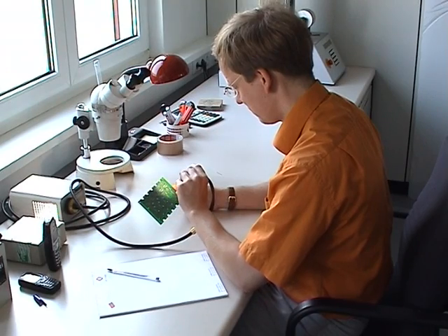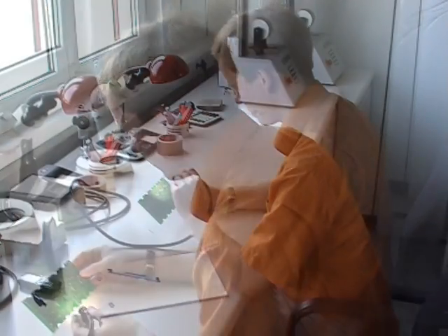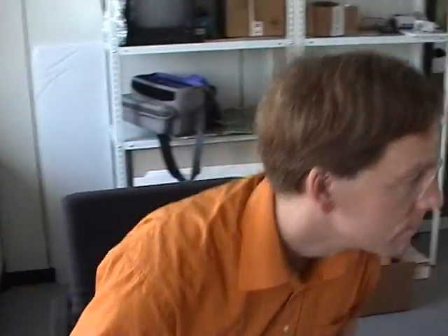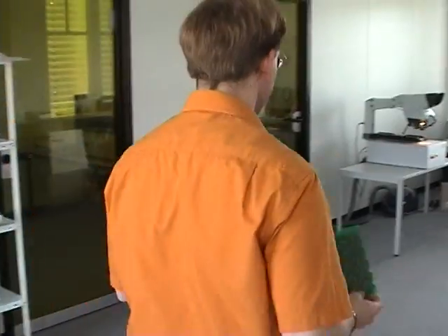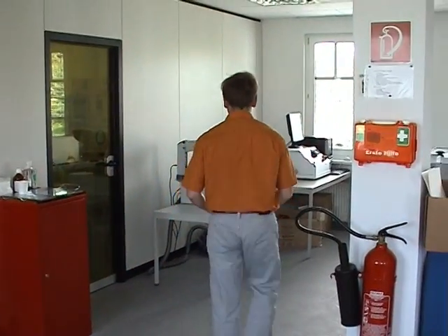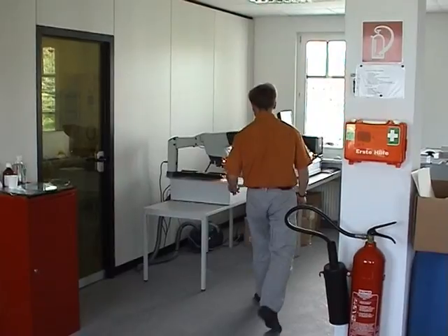After finding the right position, the specimen is routed with the optical specimen router, also called OSR.